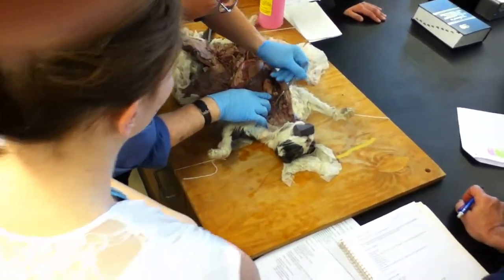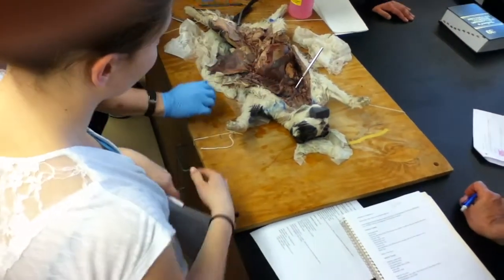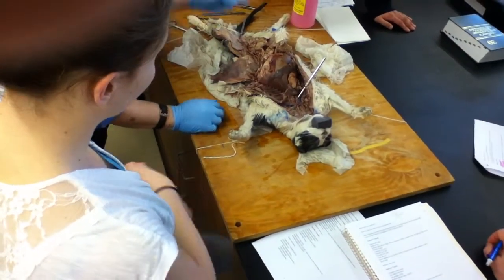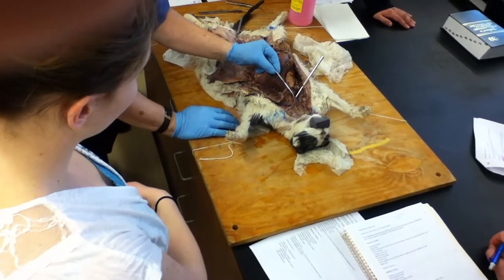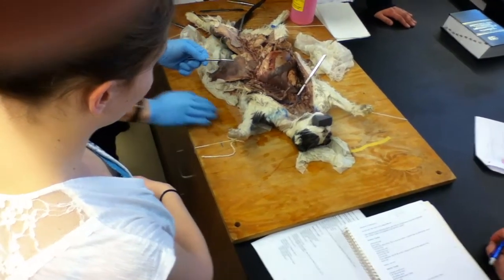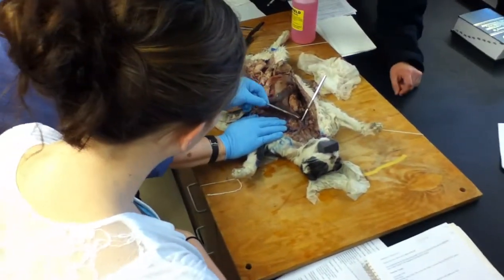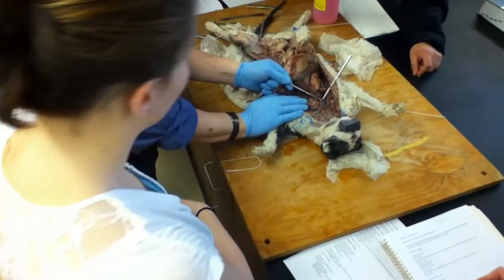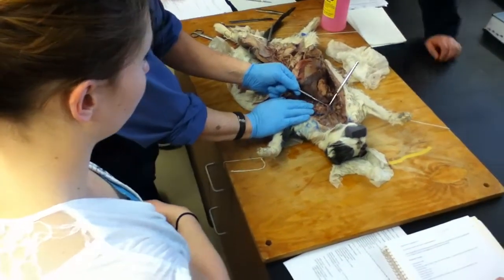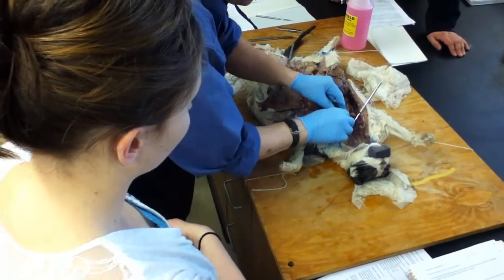Okay. So basically what we see right here, I'll move the probe there so that folks can see that. So this major branch that we're looking at here is the brachiocephalic artery or brachiocephalic trunk. Will you point your little pointer at? It's underneath, the probe is underneath it. Okay. Lifting up right here. That's the brachiocephalic trunk. Right. Now what you can't see is, say, well, how do you know that? Because you can't see anything.